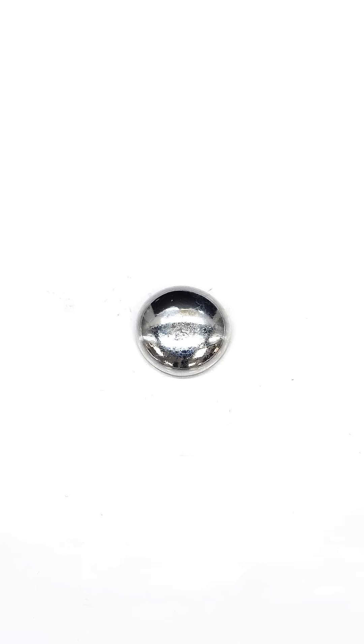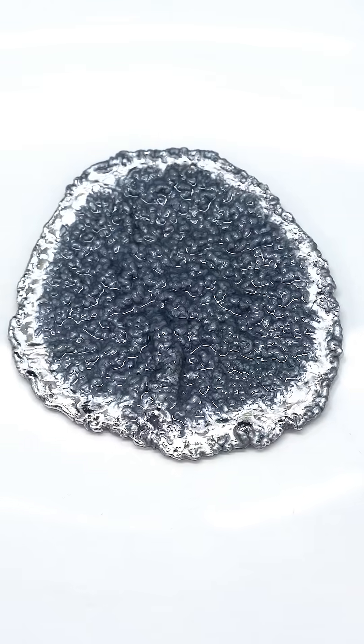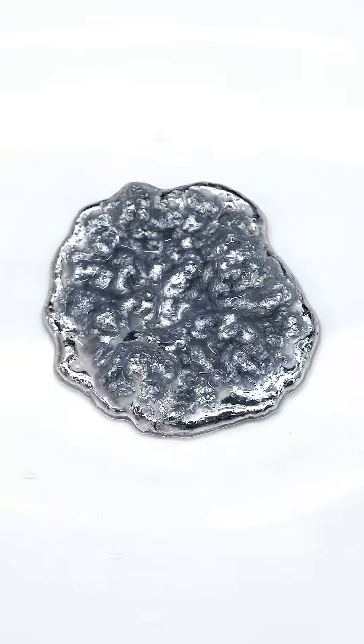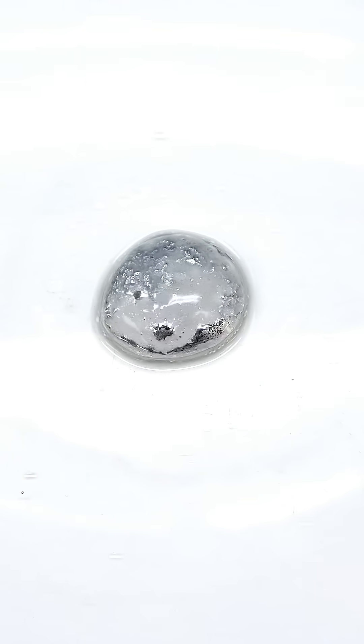Then after that, all I need to do is get a solution of ammonium chloride, and I'll add a couple drops. This caused it to almost immediately start growing and forming something called an ammonium amalgam. However, it unfortunately isn't very stable, so it all quickly fell apart.